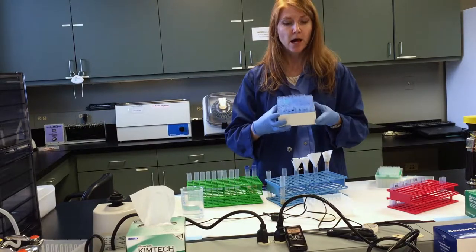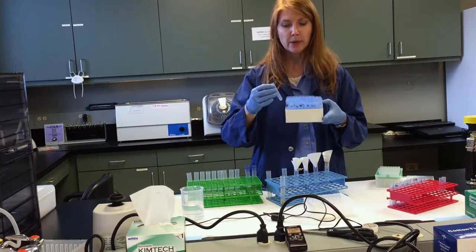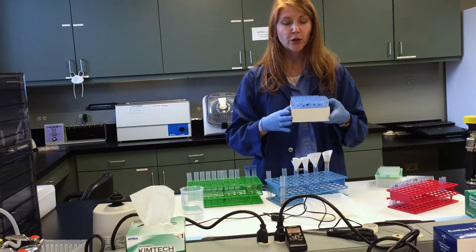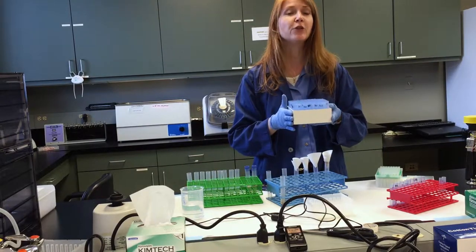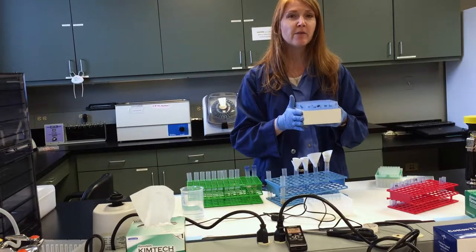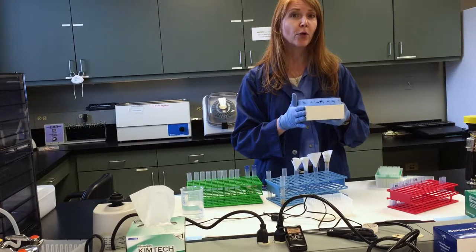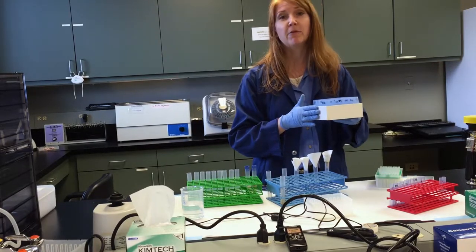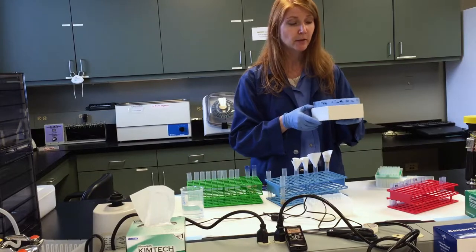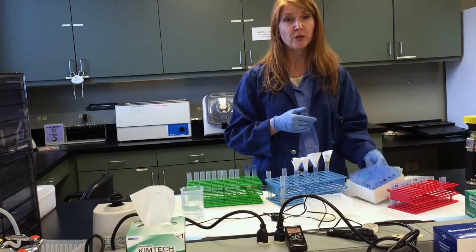And for our USDA permit, we actually had to heat treat this. So we'll put this in the oven at 72 degrees Celsius for 30 minutes. And that kills any kind of virus, like foot and mouth virus, that we could potentially bring into the U.S.